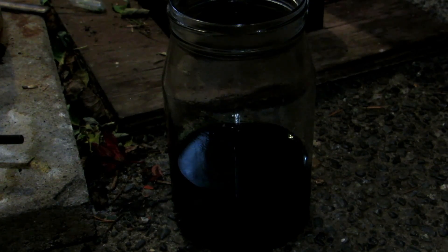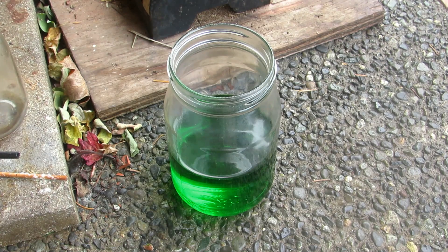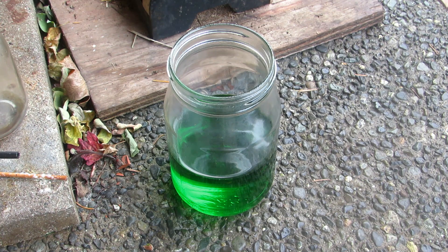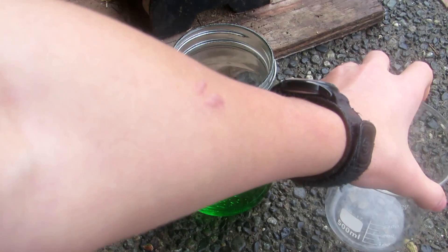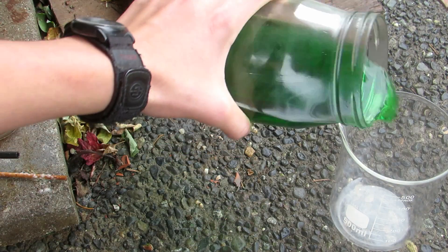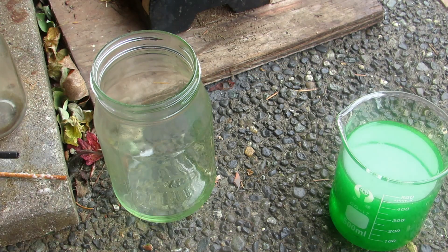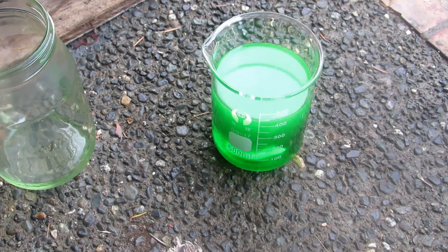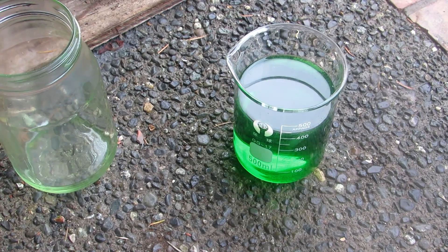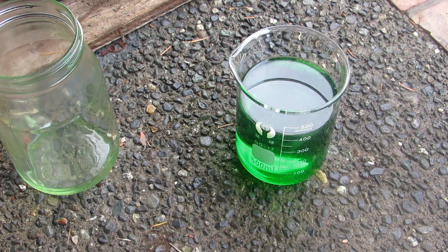It's the next day. You can see we're left with a nice clear green solution, which means all of the copper has been dissolved, forming copper chloride now in solution. But we want this as a solid for the reaction, so we're going to pour it into a beaker and boil it down. We'll transfer all of the solution to this beaker, then put it on a hot plate outside and boil off all of the liquid until we're left with a nice green solid chunk — that will be our pure copper chloride.